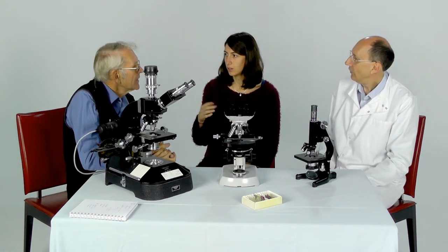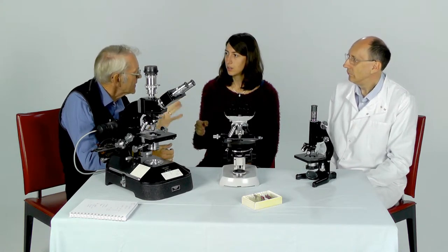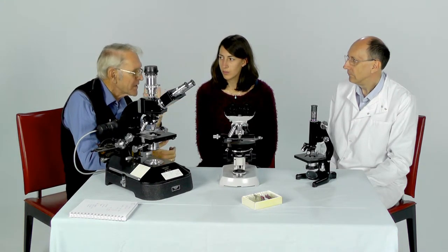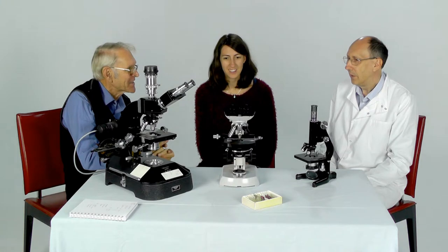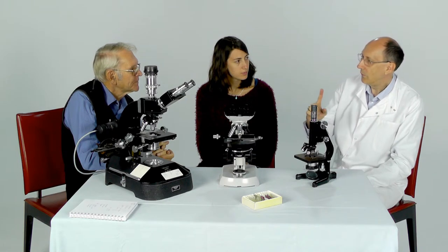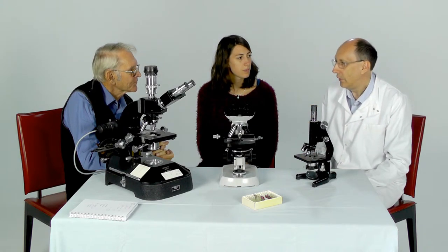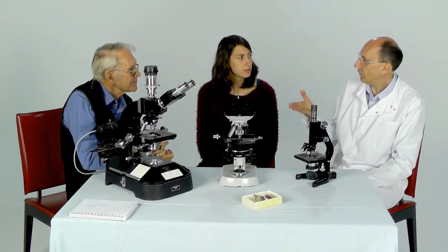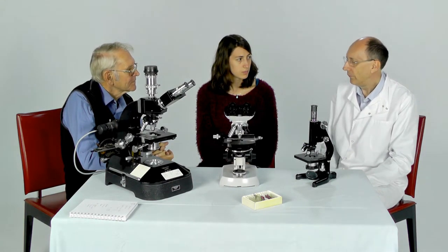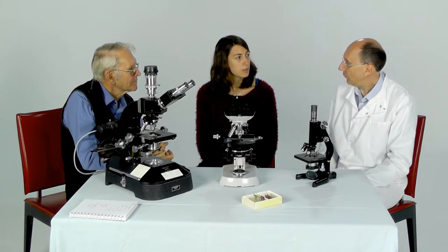Does the apochromat have colour correction? Yes, it's to do with the amount of colour correction — and it's near perfect in apochromats. The easiest way to tell when looking through a microscope is to see whether you're getting a red or bluish fringing on the outside of the light disc. That's normally an indication that you haven't got good colour correction. When it gets to good quality achromats or apochromats, that fringing will all disappear and you'll get perfect colour reproduction.